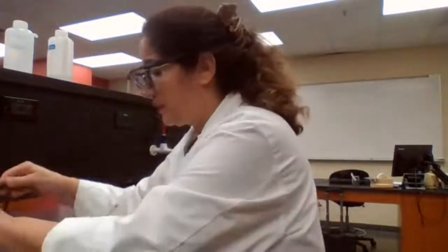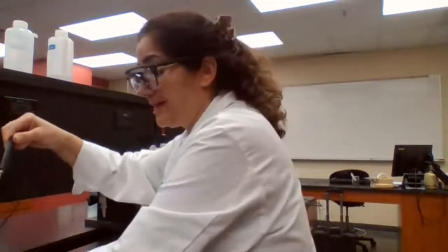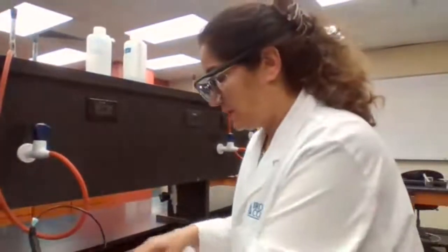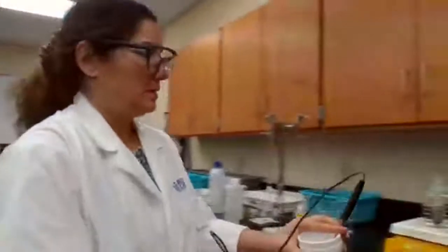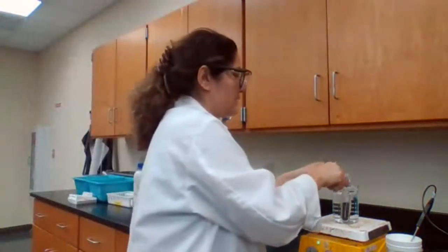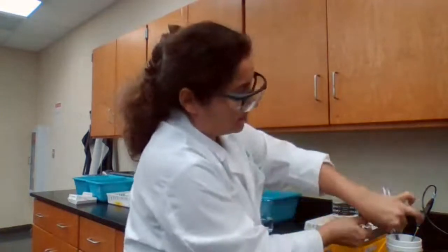So we're going to add the metal to cold water, and wait for the change in temperature. So I'm just going to carefully bring it to this side because it's very hard to bring the heavy copper using the holder is not very safe. So I'm going to have to take it, slide it, and add.